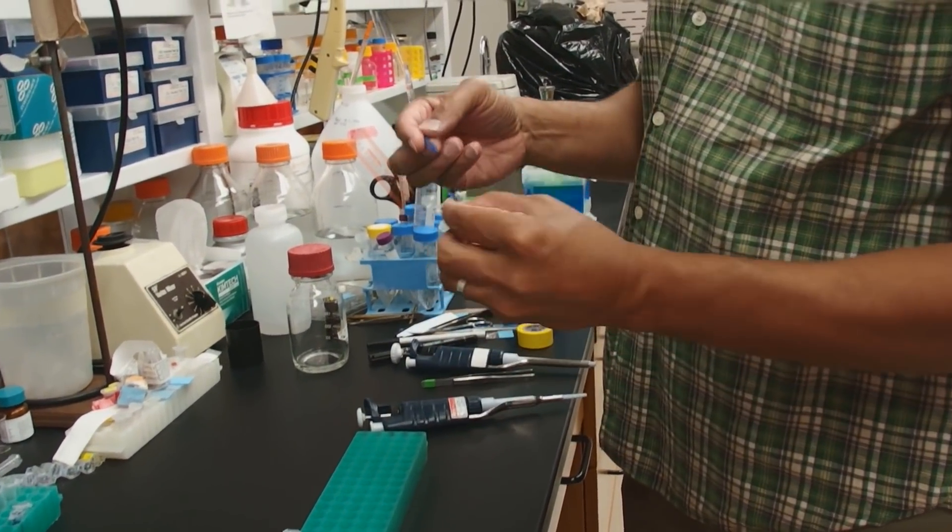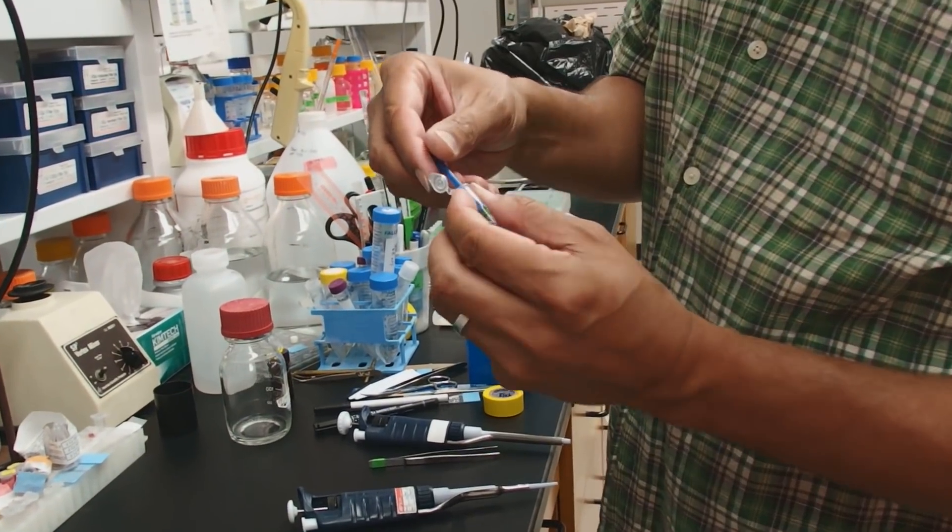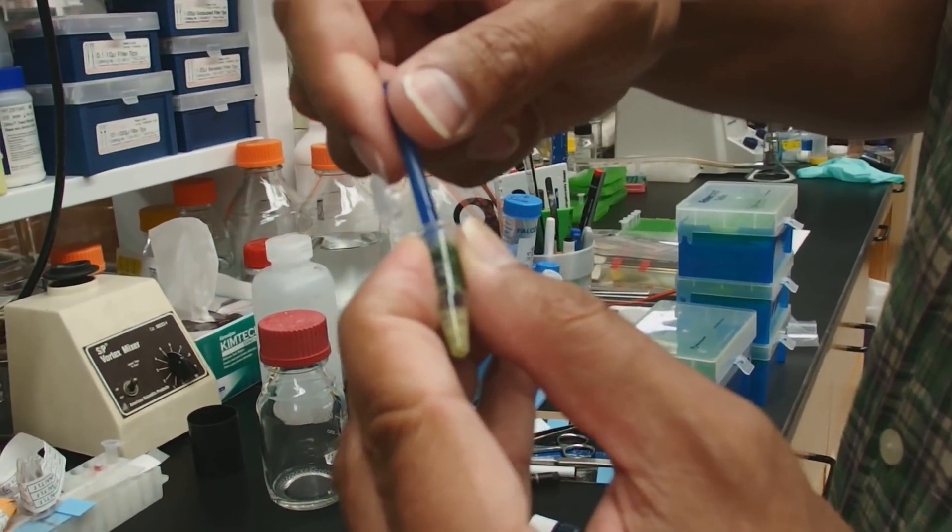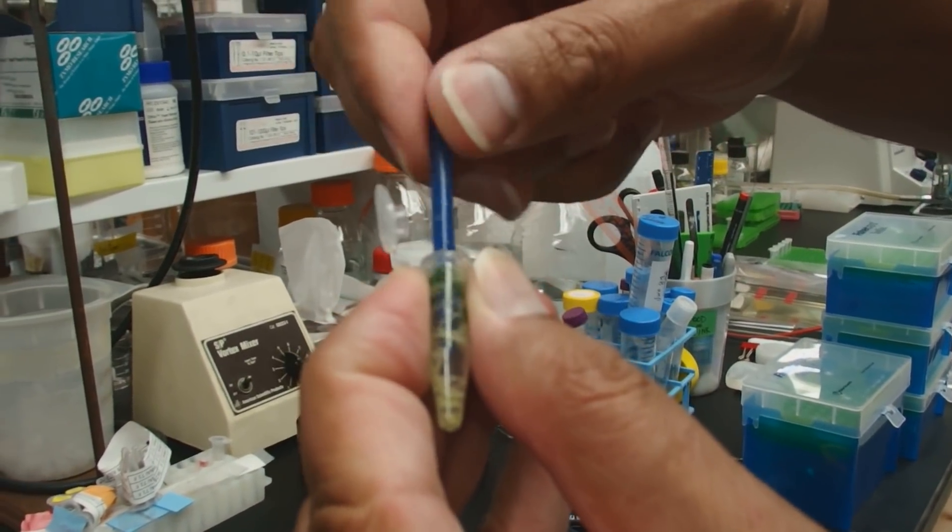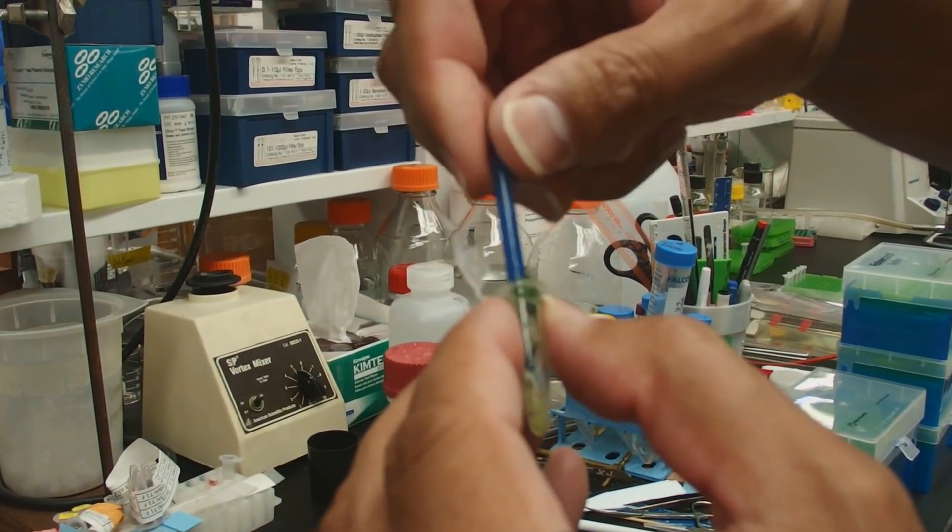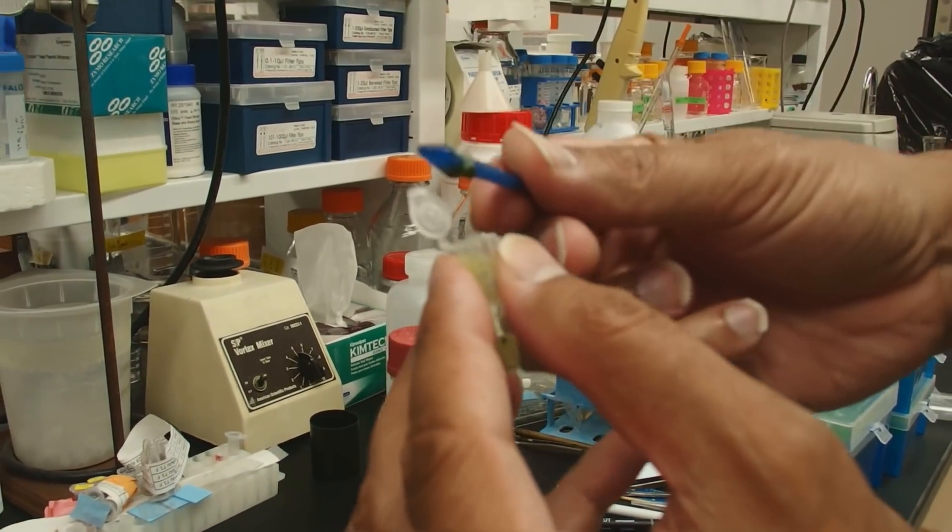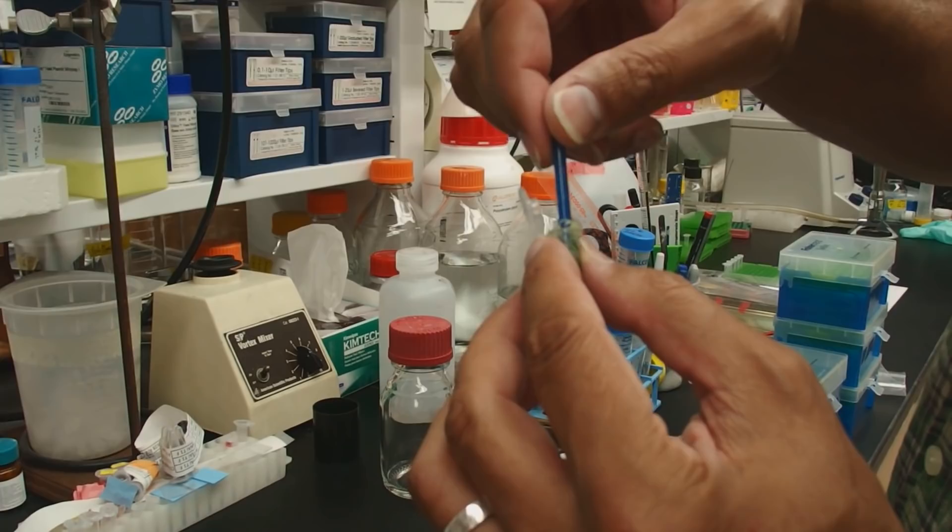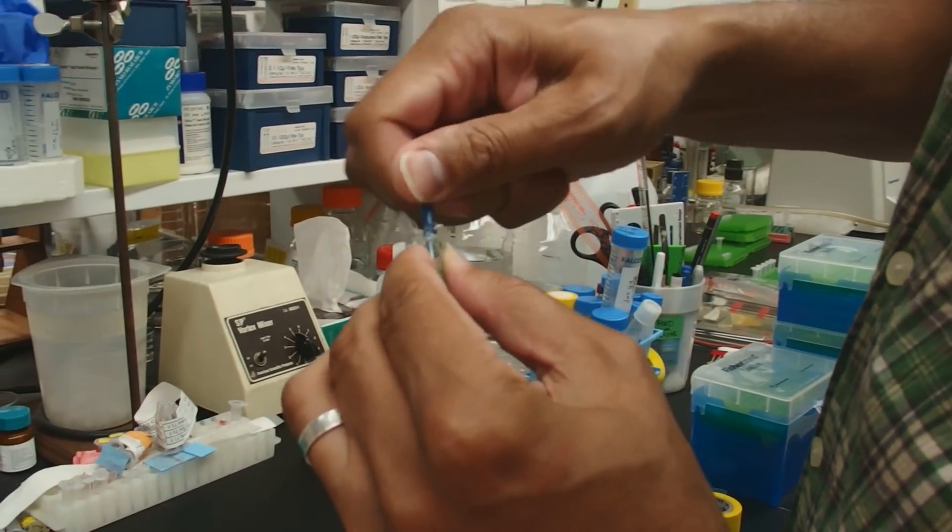Once that's all in the tube, we're going to take our pestle and I'm going to just grind. Grind until it's homogeneous. It doesn't need to be so good. If you have trouble to keep your stuff in there, you have to work this.